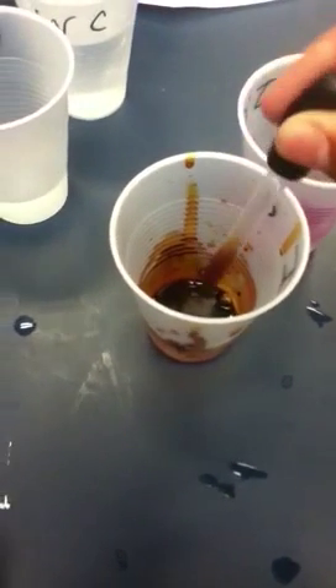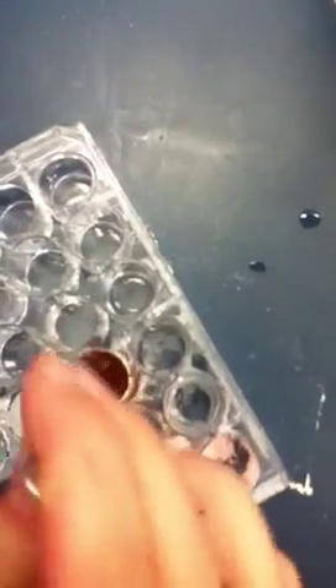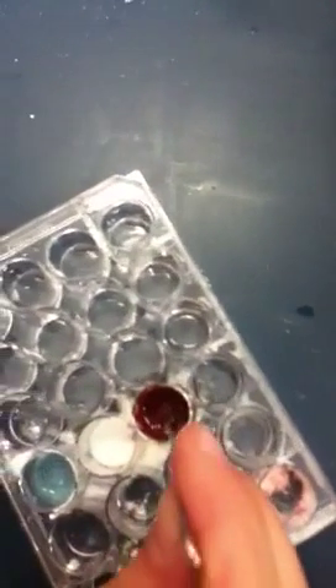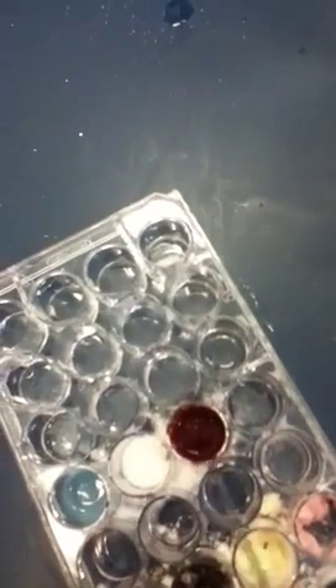It's probably like 10,000. Shut up. Negative. Disposable. We're gonna keep our stuff out. Negative. It's turning red. Look at that. That's so cool. It's supposed to turn either black or red — black purple. Looks like fake blood.